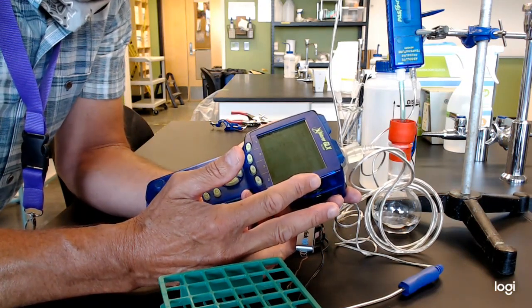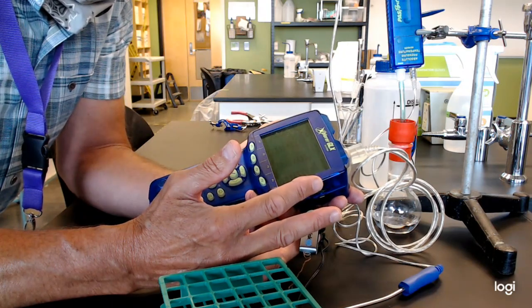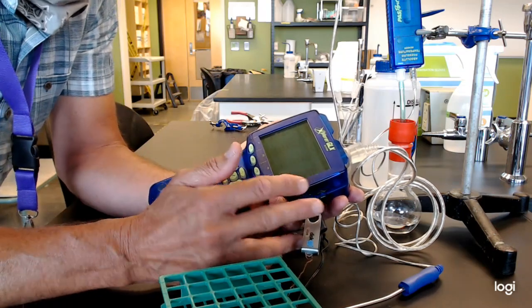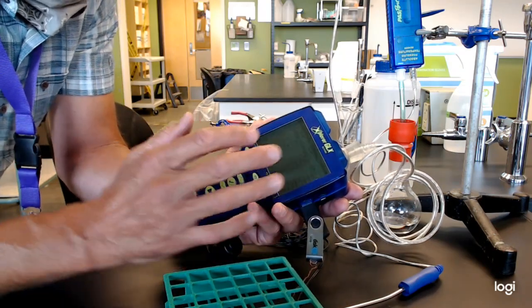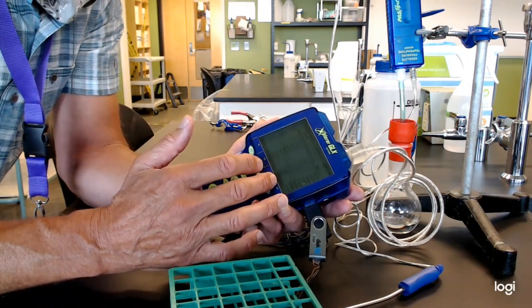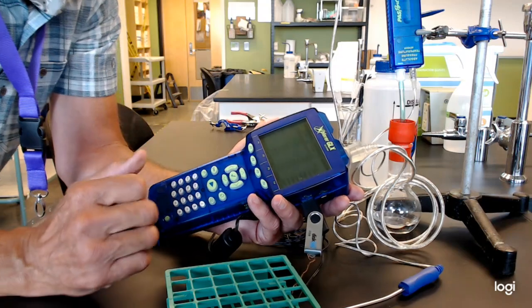So now we're ready to take this off to the computer. Before we do that, though, I just want to show you a couple other features of this thing that are common things that go on with students. And also, just heads up, this is not Windows-based. You don't have to somehow look for something to say is it okay to remove the flash drive. It's just kind of dumb, stupid. Take it out, put it back in. That's all there is to that.